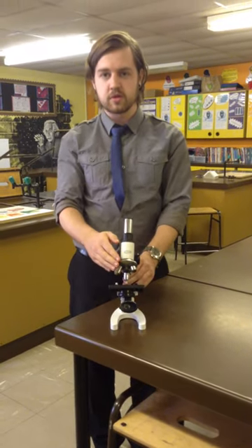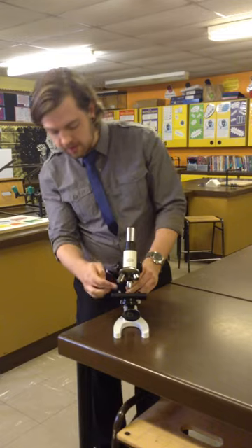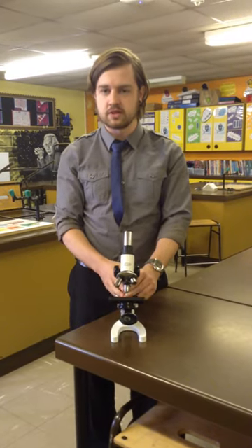And then on you go. Be very careful when you go up to the highest magnification because the slide will get very very close to the lens and there's a chance of them breaking.